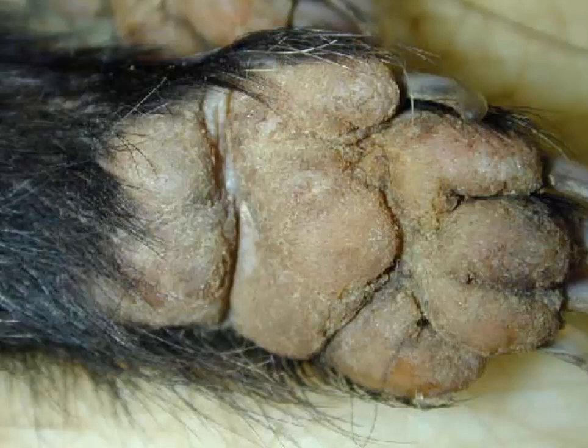Okay, time's up. A classic lesion in a classic species. This is hard pad disease, and if you know about distemper in dogs, you know all about it in mustelids. It affects mustelids even harder than it does dogs, and the morphologic diagnosis for this particular lesion is a diffuse severe hyperkeratotic pododermatitis. Usually starts on the nasal planum, the paw pads, and the chin. The cause is canine morbillivirus or canine distemper virus.